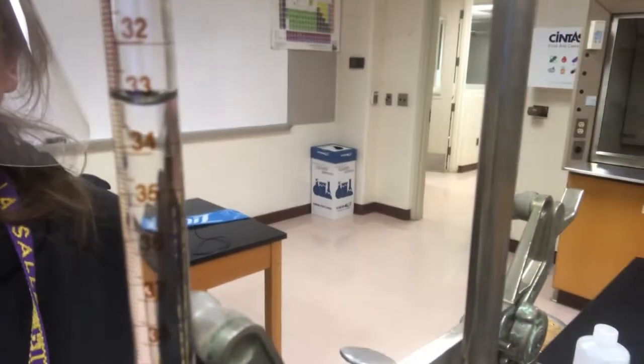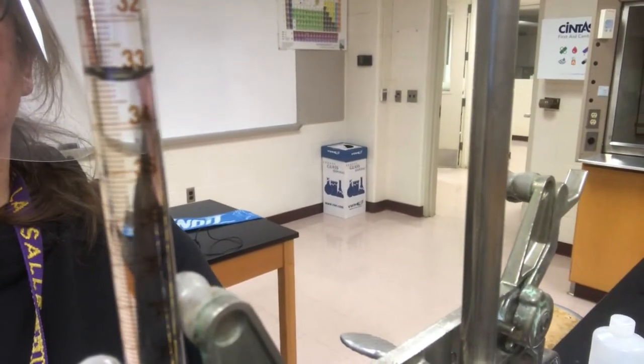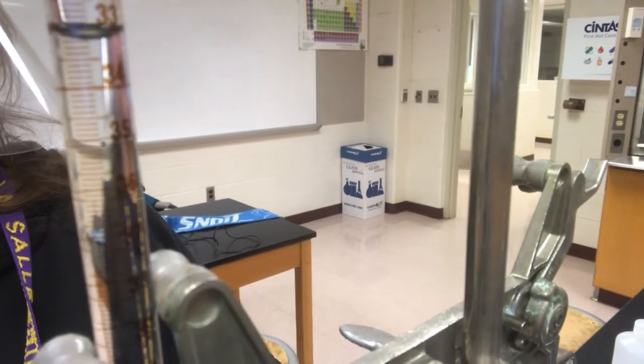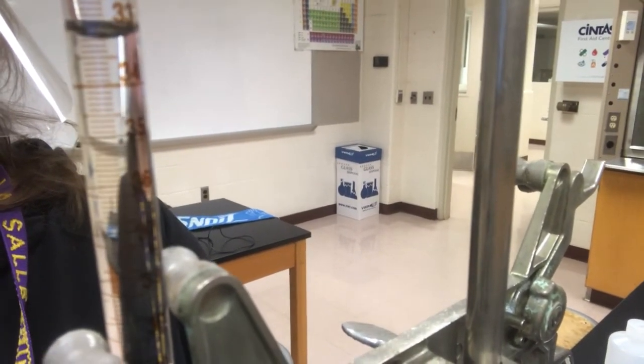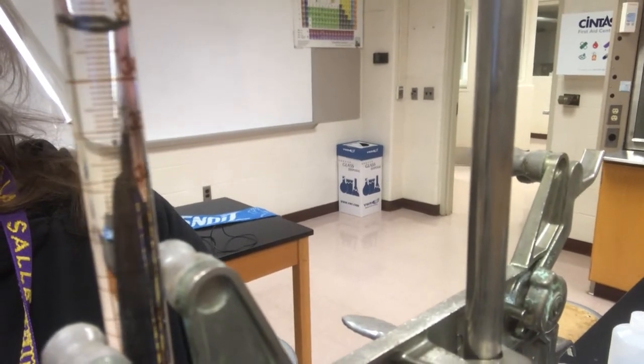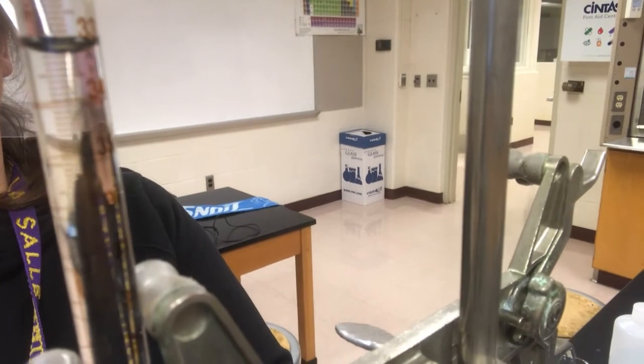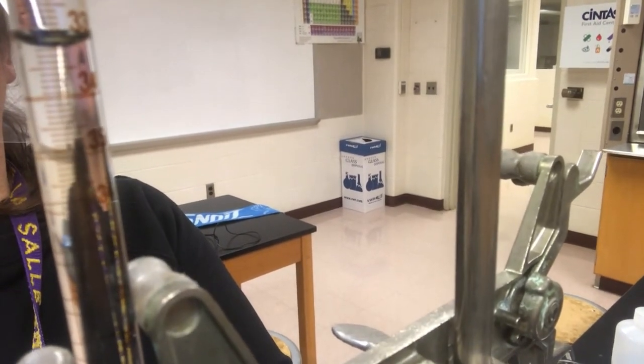Where's the meniscus? I can see it pretty well, but it's not showing up. Oh, I'm not high enough. There we go, so there's your meniscus. Let me turn it so you can see the numbers. Against the whiteboard, I think you can read it pretty well. Turn it just a tad more. There.